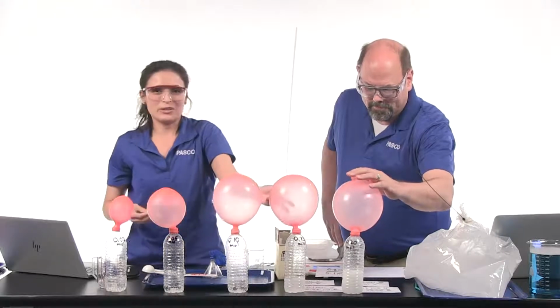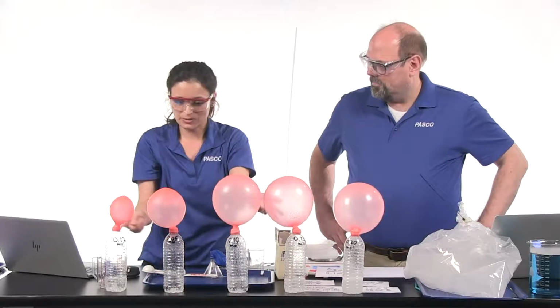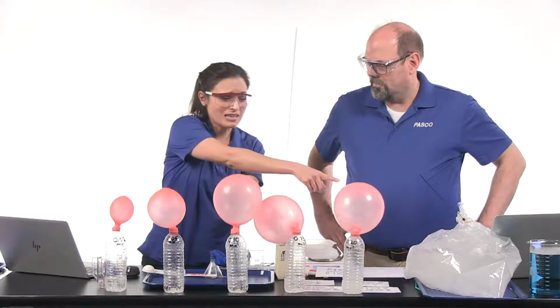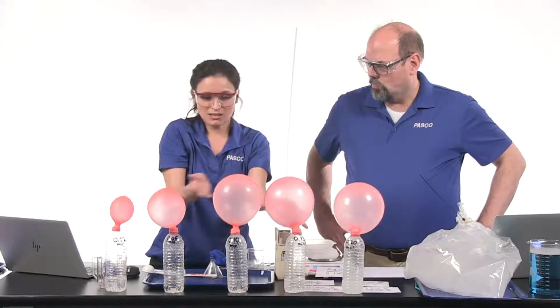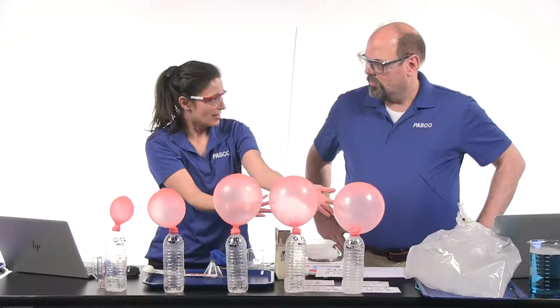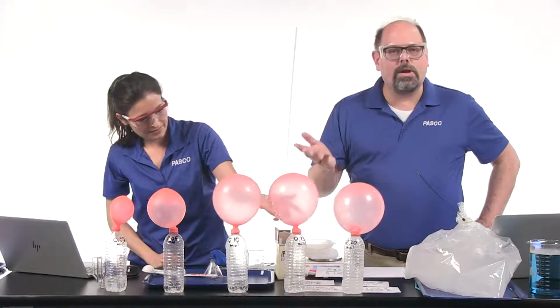So your students might predict that the largest balloon would be the one with the most baking soda, since the one thing that's controlled here is the volume of vinegar, or the moles of vinegar is the same. They might have predicted that that one would get the biggest, but you can tell visually that the last 3 have the same size. In importance, chemists wanted to study these kinds of materials to see what ratios they reacted.